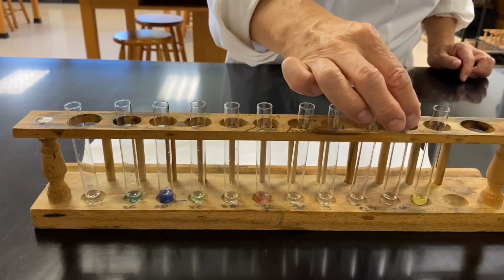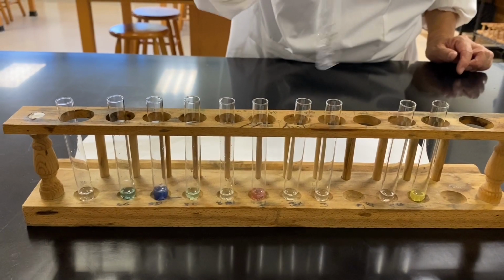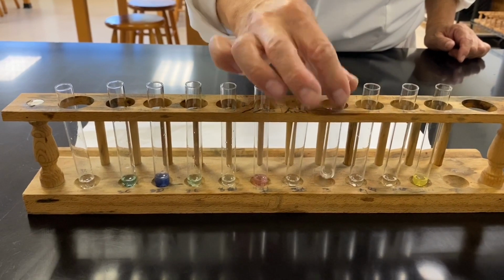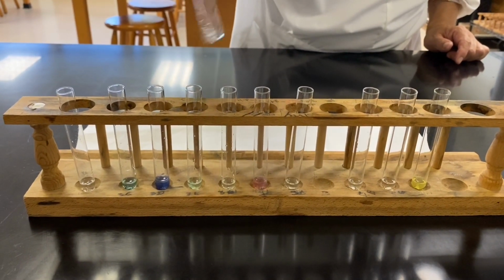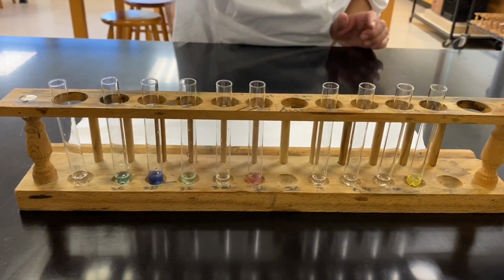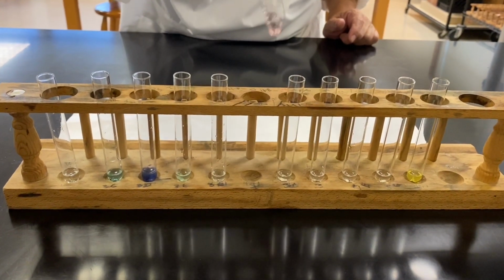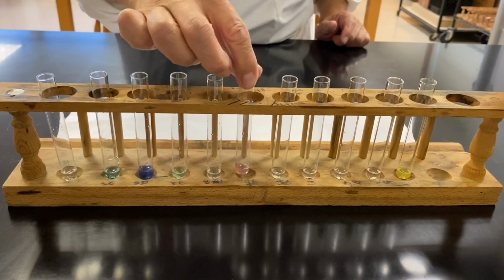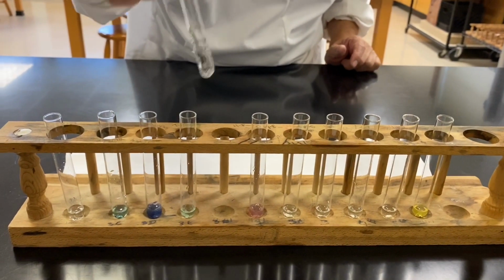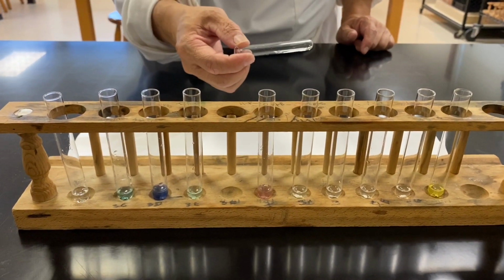Beautiful, right? Today we pay no attention to the bubbles, because number one, the solution is acidic, and number two, magnesium actually reacts with water, and you will form magnesium oxide.